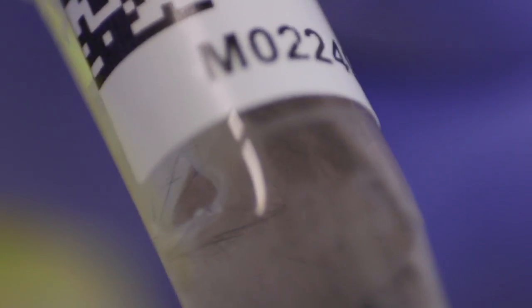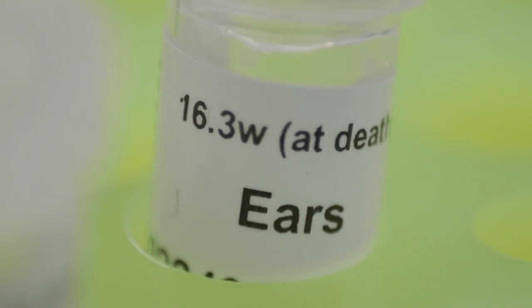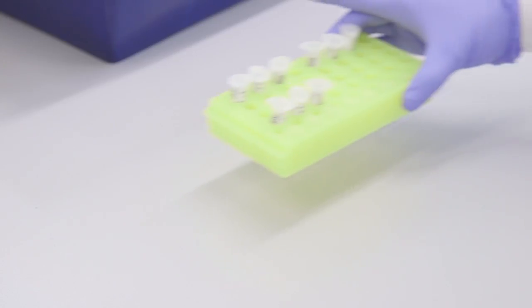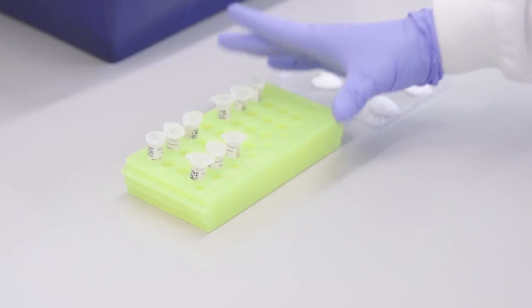Each set of ears is collected from a humanely culled mouse. They are then placed into a labeled tube containing PBS at pH 7.4. These tubes are kept at room temperature until all samples have been collected. The tubes are then brought to the lab ready to begin the peel.